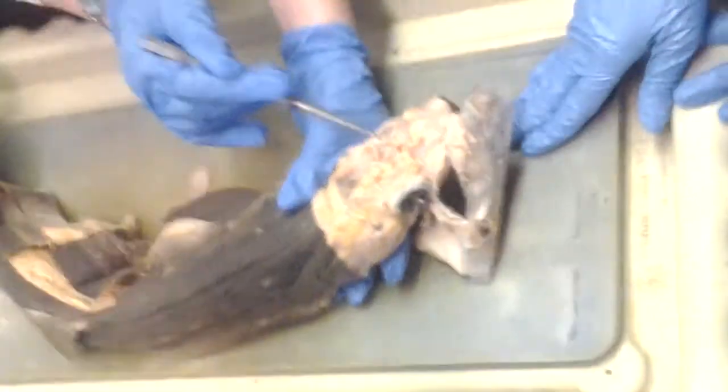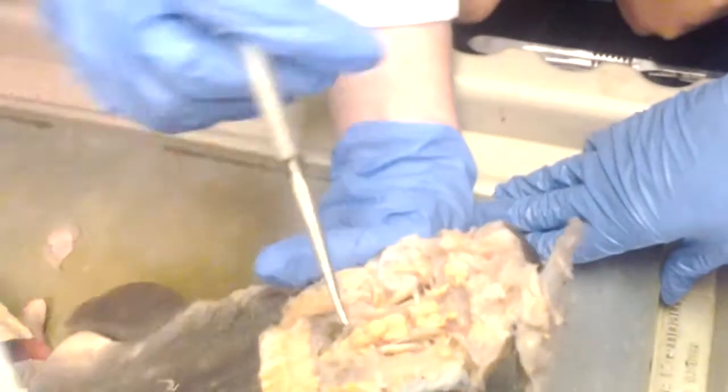Okay, optic nerve. Bottom one. You can see the optic nerve up there. So the optic nerve is here, by the eye. Yes, this white thing here. All right, so this is the optic nerve right here, this white thing. And you can see it on the other side now. The thing that goes across this way, the one I showed you before. So these are the two optic nerves here, the white things that go straight across. Here's one and here's one.